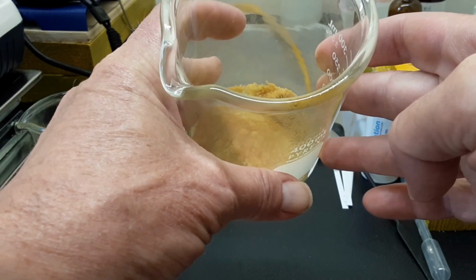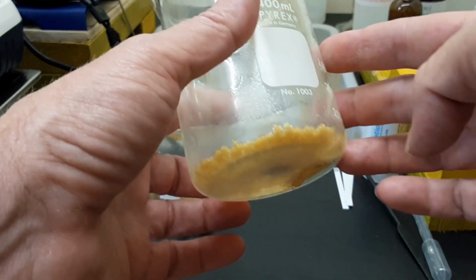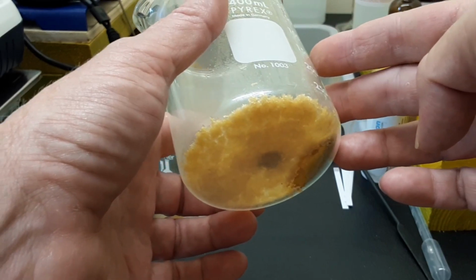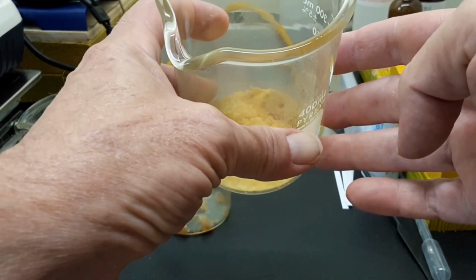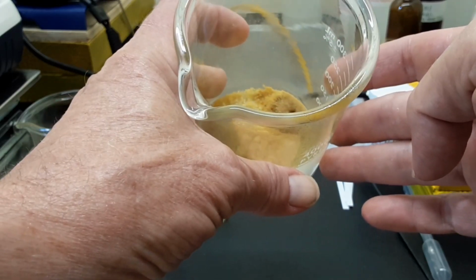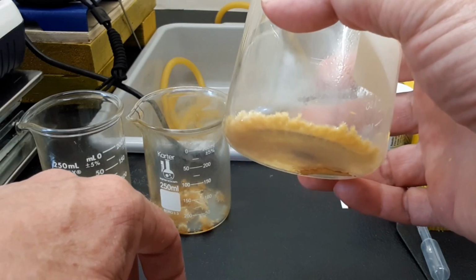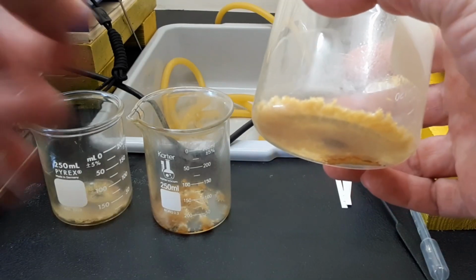It was definitely as white as you could really get. I didn't add that much water into it at that point, so I said, well, hell. So I just went ahead and added a 10% solution of potassium hydroxide to try to recover from it. This one here actually got refrigerated 2 times. I'm not sure how that worked out.